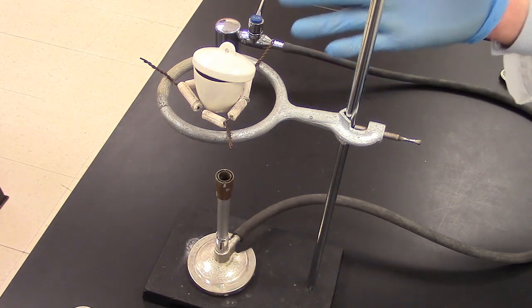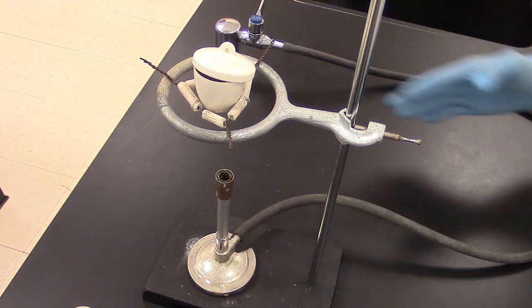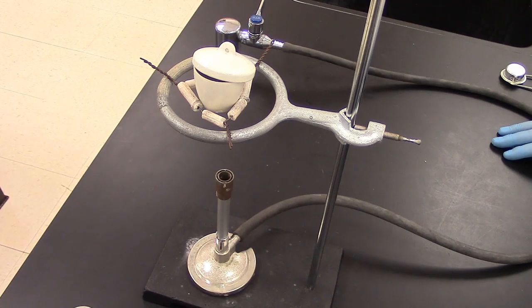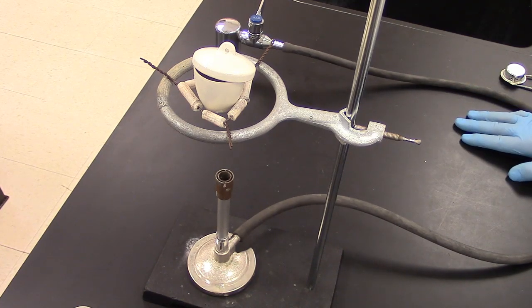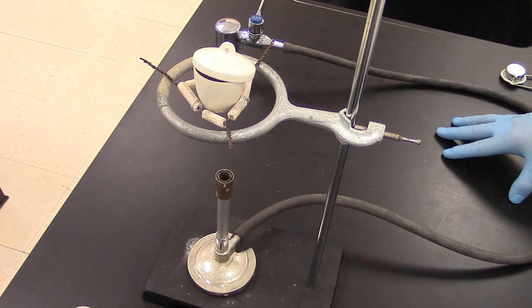We can't tell the difference between a cool crucible and a hot crucible, so we're just going to assume that this is hot. We're going to give it a couple minutes to cool down. Probably five minutes is enough time for it to cool down, but when you do go to check it, be careful.